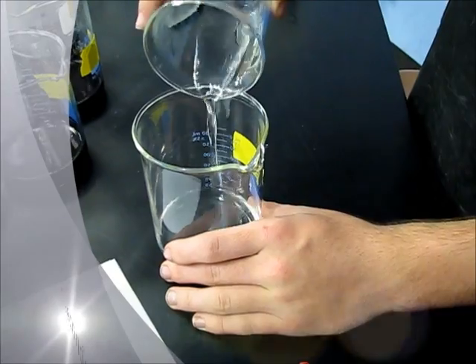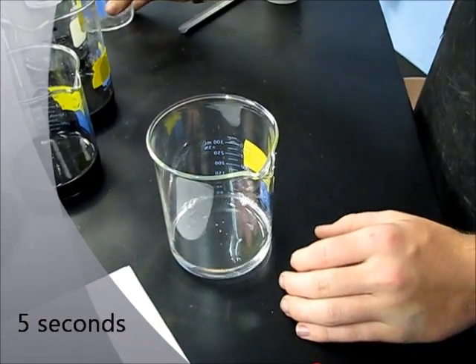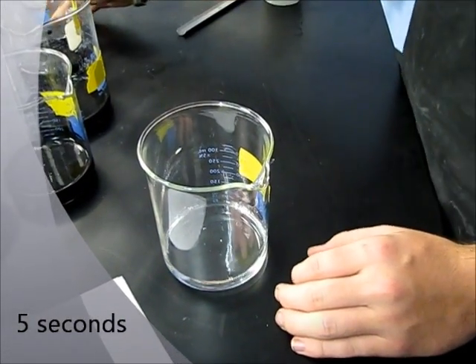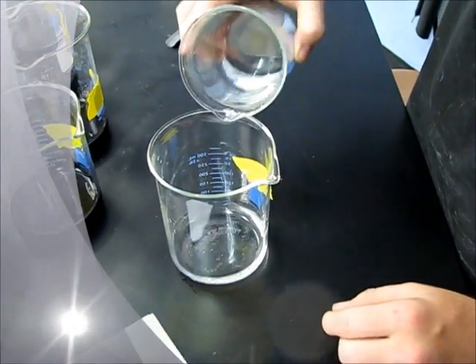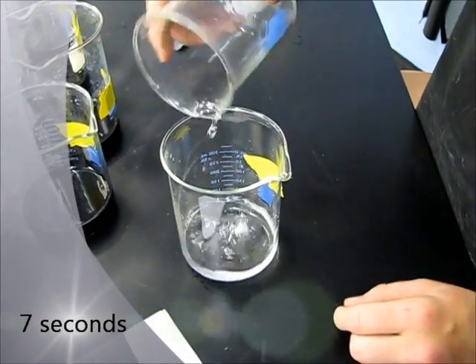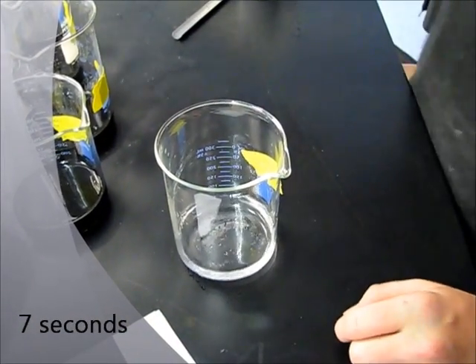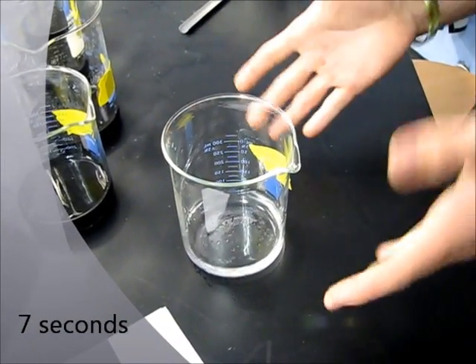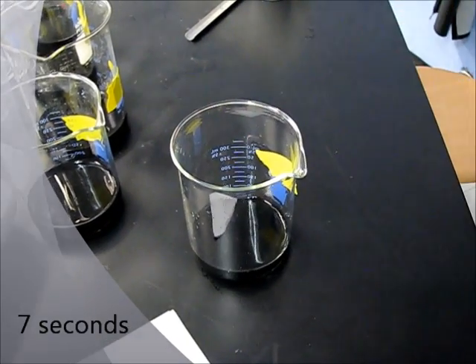First, I'll test the effect of a change in temperature on the reactants. Increasing the temperature of the system increases the reaction speed, whereas decreasing the temperature slows down the reaction speed because the molecules move slower and take longer to collide and react.